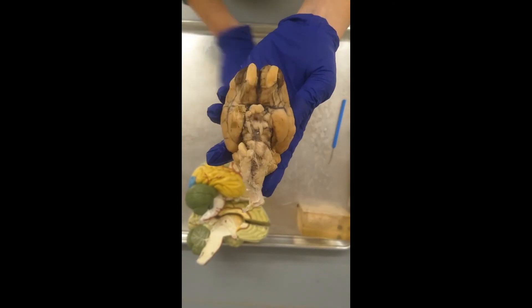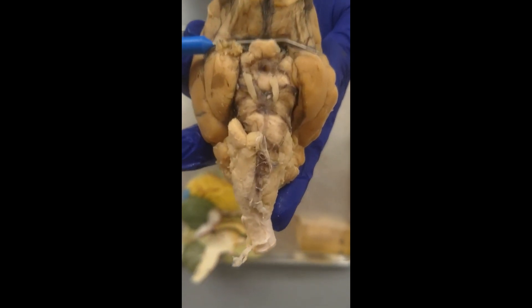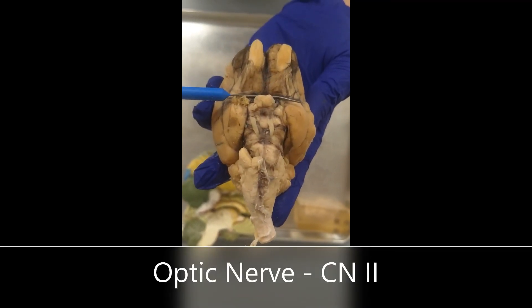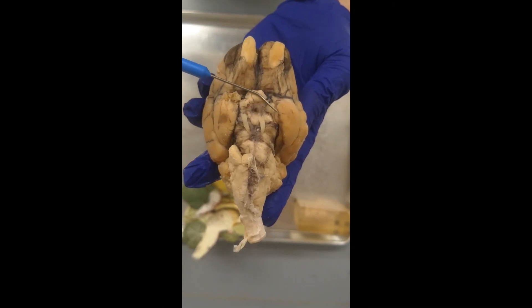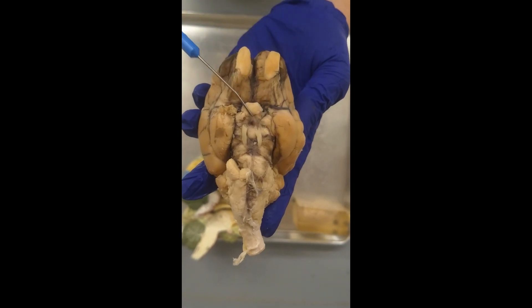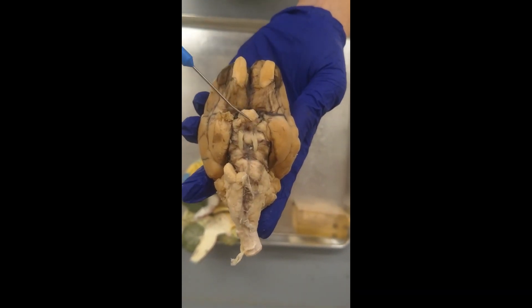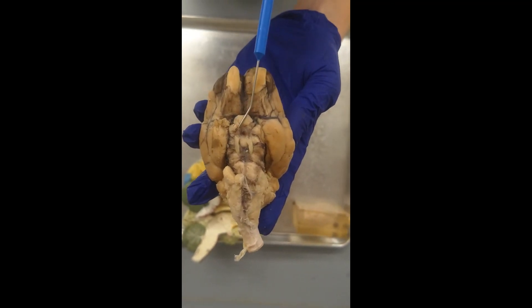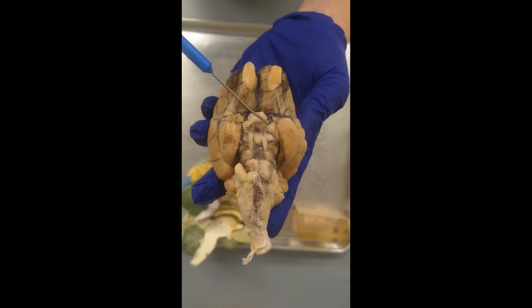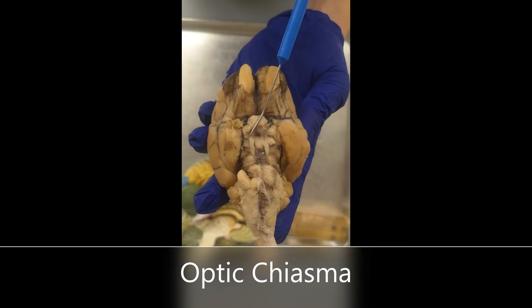This right here — these little nubs — is actually going to be part of the optic nerve. This is where the optic nerves cross. You have the optic nerves crossing right here, and this little X — the extension has been cut off — but this is the actual little X. We call this the optic chiasma. Chiasma just means X, so this is where the optic nerves — cranial nerve number two — they cross.